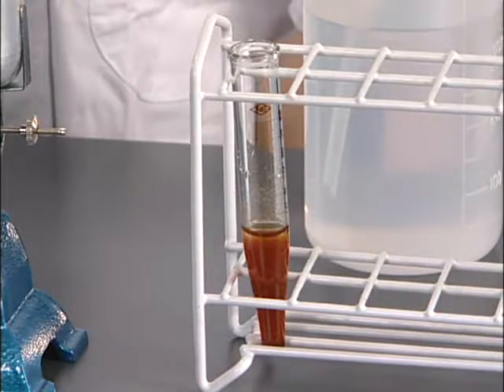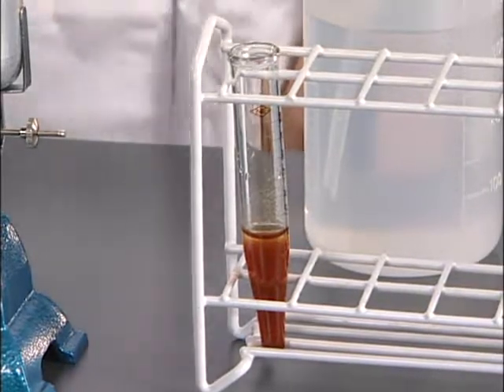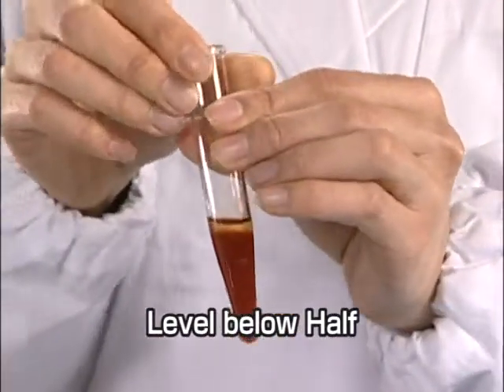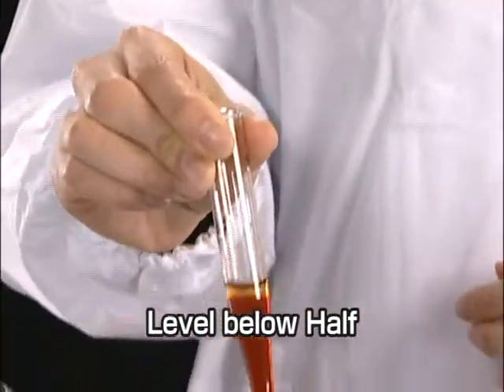First prepare the sample in the centrifuge tubes. Keep the sample volume below half or the liquid might overflow upon centrifugation.